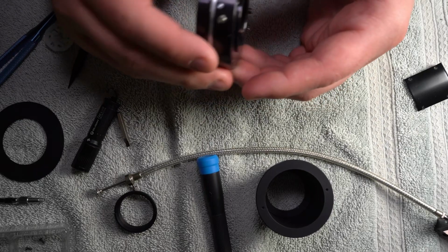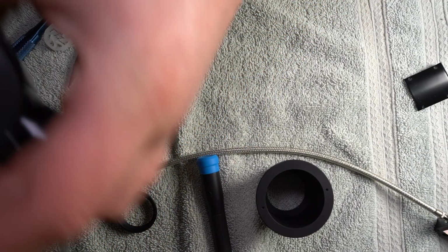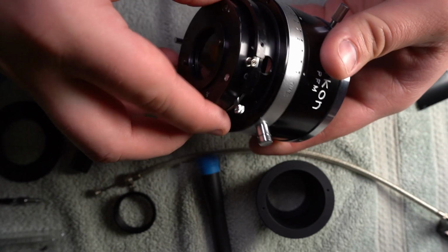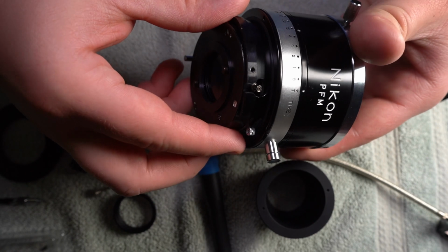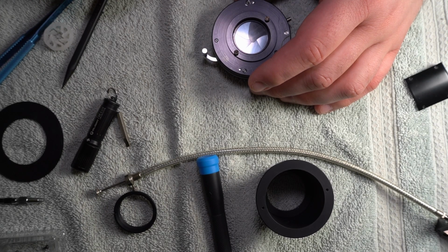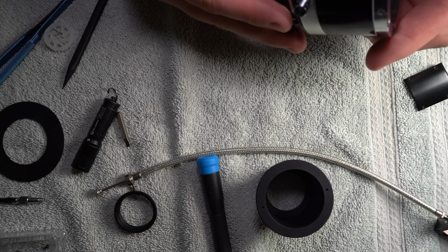But actually no, I take it back, because this kind of just floats. It's kind of weird how they do it. It floats, and where is it? That's not it. Where is it? There it is. So this actually goes in like so in here. And you see this little notch, this little keyway looking thing? It goes in there, and if it didn't have those alignment screws, it would just bang around in that. And you don't want that. So they put the alignment screws there. Okay, and now I'm trying to think if there's some other way that this works. This goes in here, right?